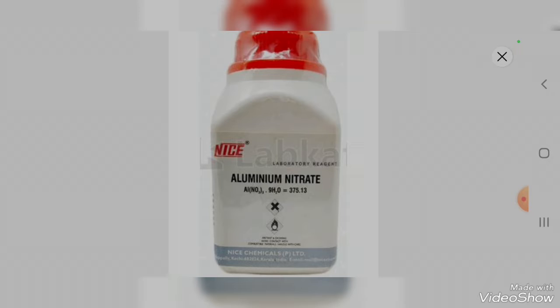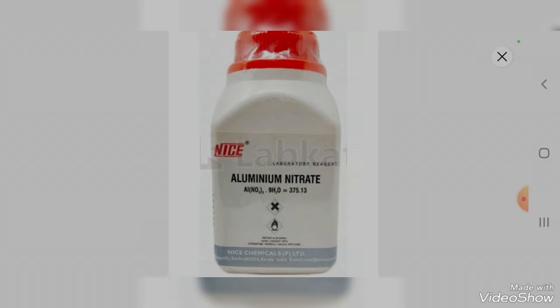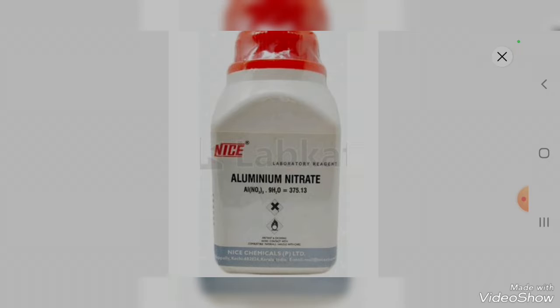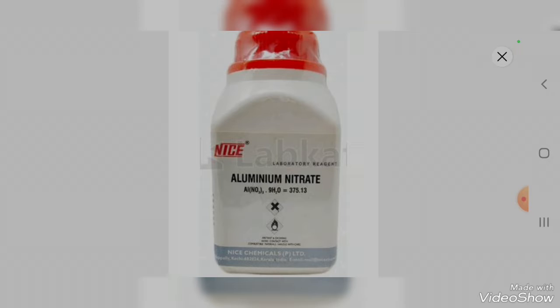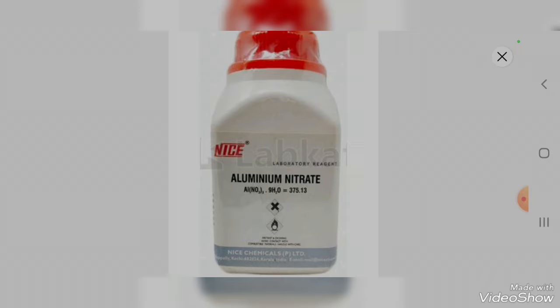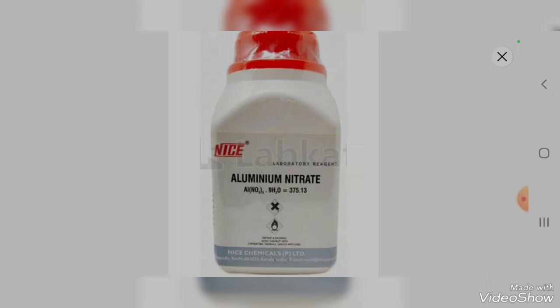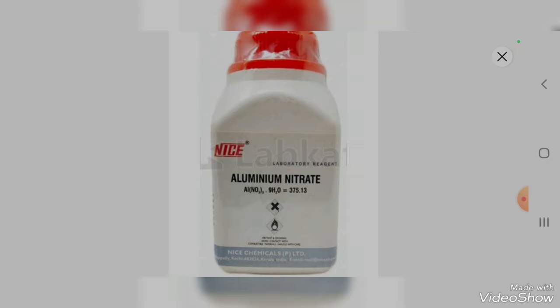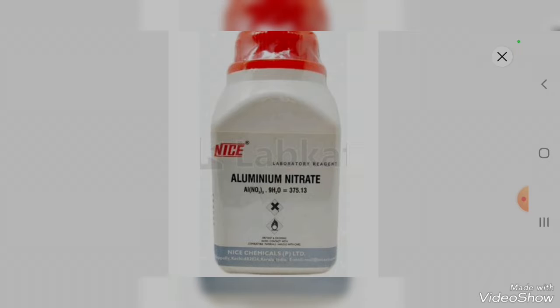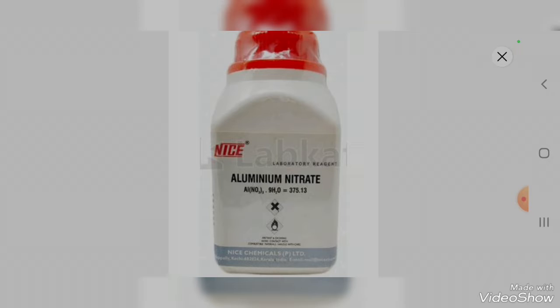Aluminum nitrate is taken as the oxidizer; it is the raw material for the final desired product, which is aluminum oxide nanoparticles. For example, if you require zinc nanoparticles you would use zinc nitrate as the oxidizer. Here I am synthesizing aluminum nanoparticles, so I am using aluminum nitrate as the oxidizer.